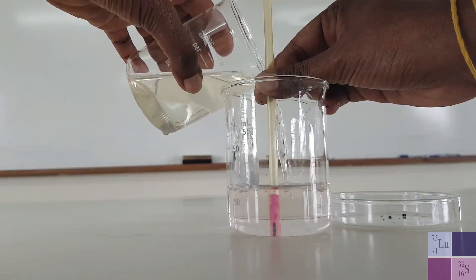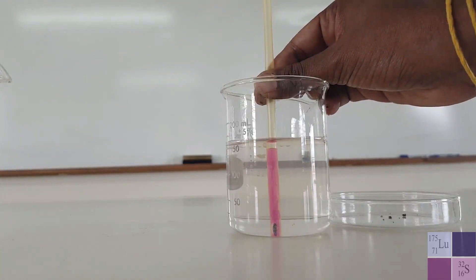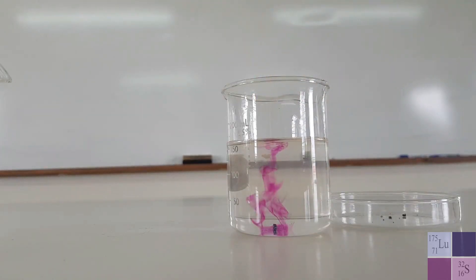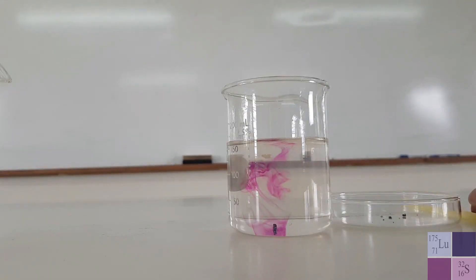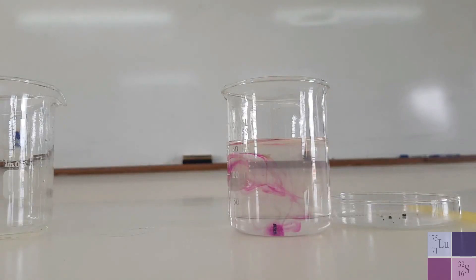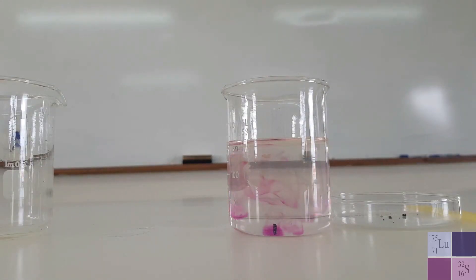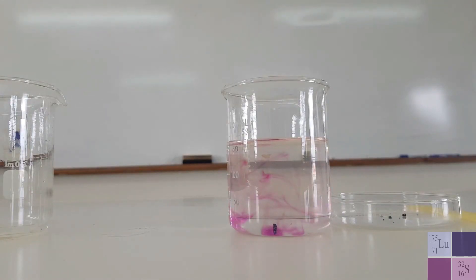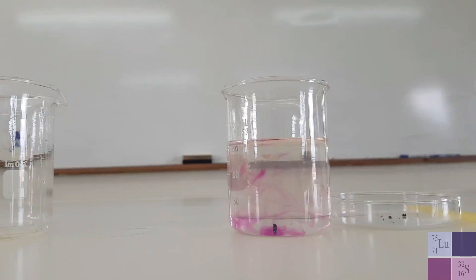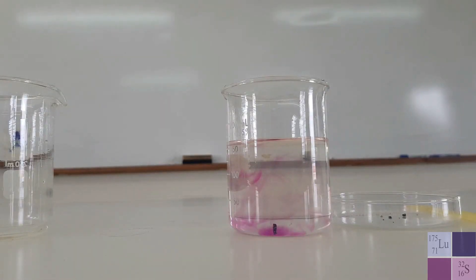It was not as successful as I had hoped, but we can still see that the crystal is isolated, even though some water got in. I'm going to gently remove the straw. Now we just need to record observations between now and about an hour's time. You need to tell me what you see at the start of the experiment — describe what it looks like now — and you can describe what you see at any point in the middle of the experiment. We'll come back soon and look at what happens to the beaker of water with that crystal of potassium permanganate after an hour has passed. So let's leave this running for a bit.